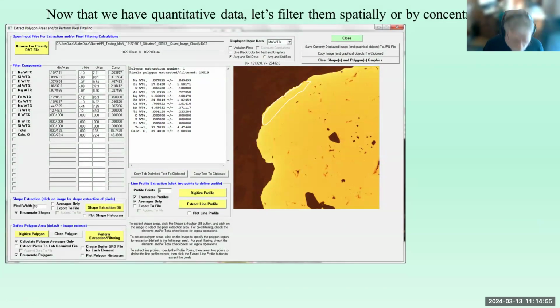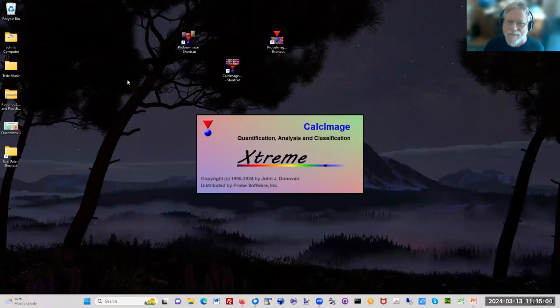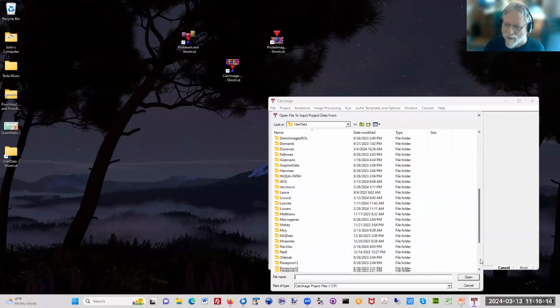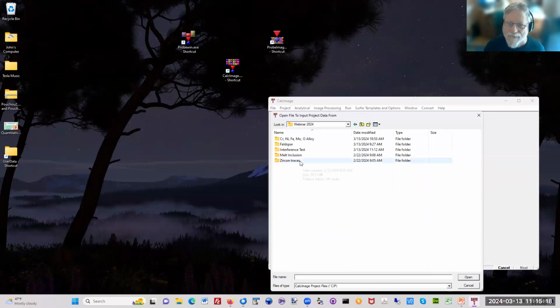Okay. I think I'm going to show one more thing. Let's see, let's go up here. There was one thing I skipped, probably 10 things. So I'm going to open up another existing project. Let's see, conclusion.